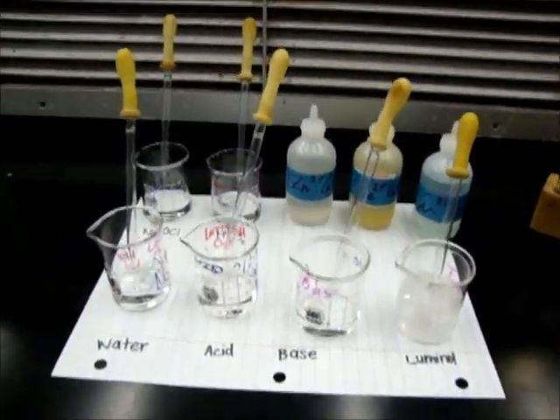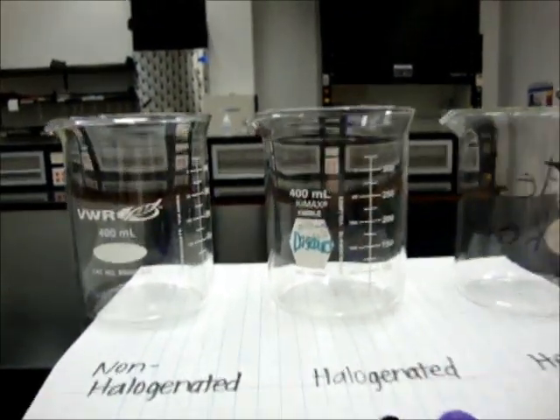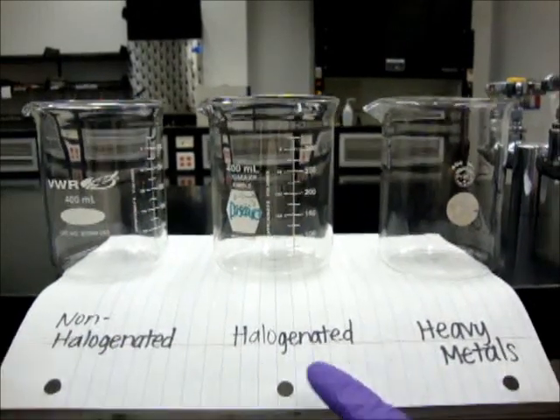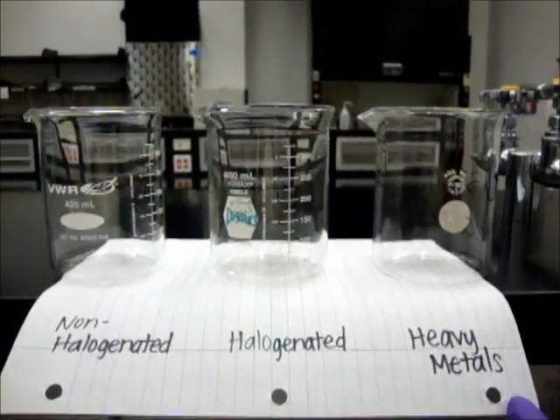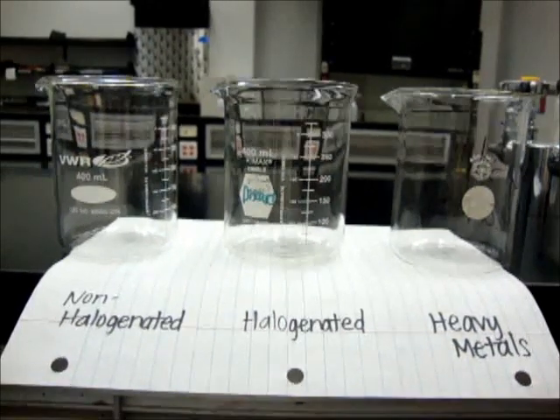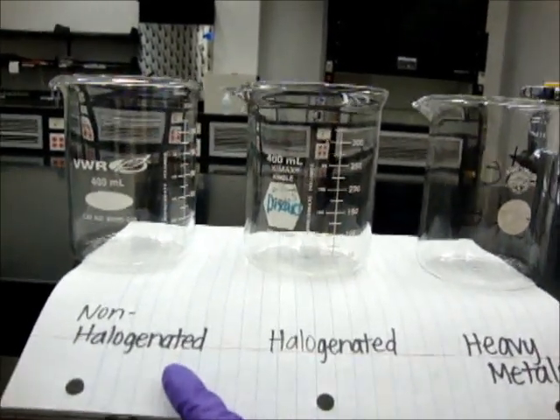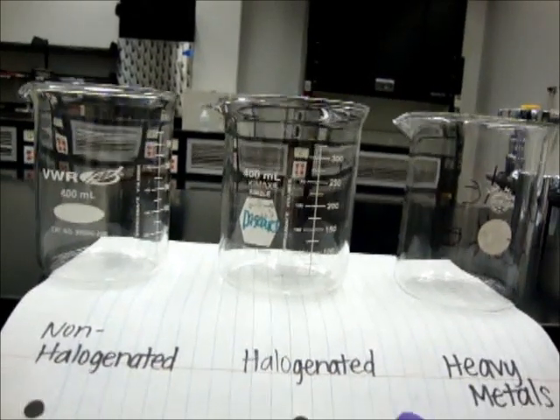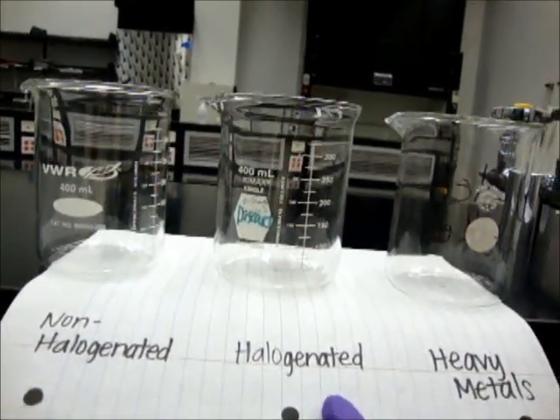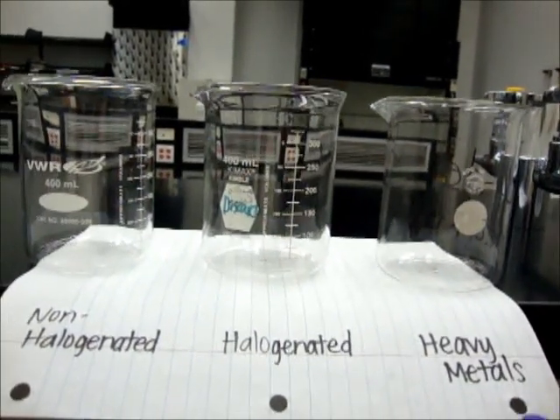Now, prepare three large beakers for your waste. I've labeled them as non-halogenated, halogenated, and heavy metals. Luminol and hydrogen peroxide should be disposed of in the non-halogenated waste, since they don't contain any halogens. Bleach goes in the halogenated waste, since it contains chloride, a halogen. And catalysts go in the heavy metals waste, since they are metals.